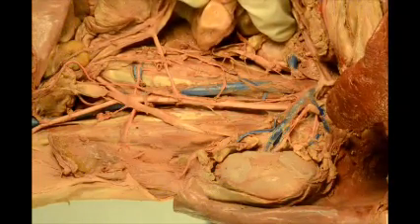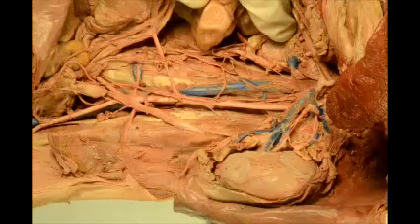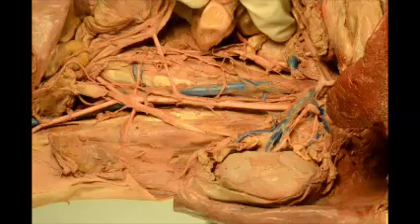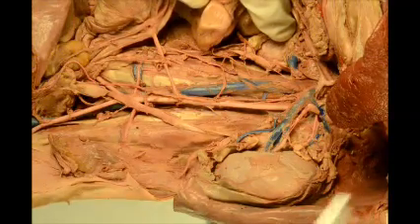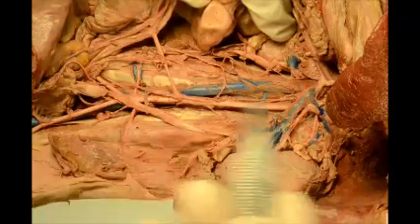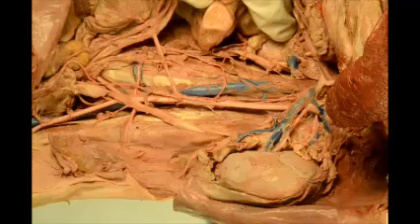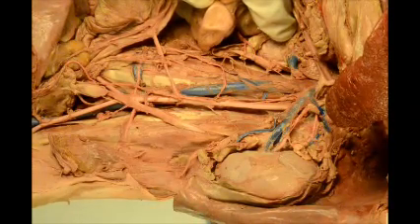I'm going to do the veins of the lower abdomen. Please remember that the blood supply travels from the feet up to the inferior vena cava. But I'm going downwards just for teaching purposes. Remember, the blood flow is taking the blood back to the heart via the inferior vena cava.